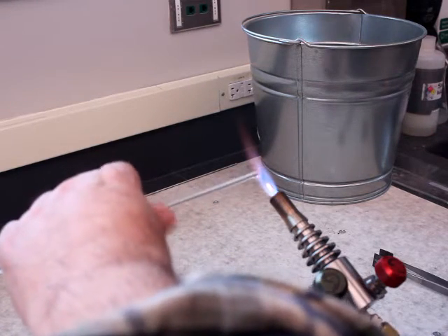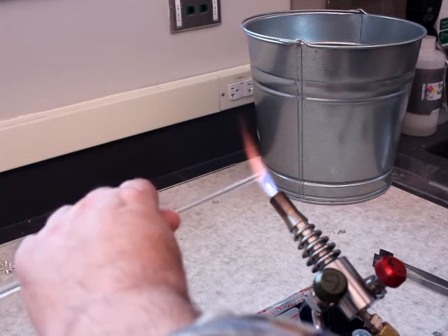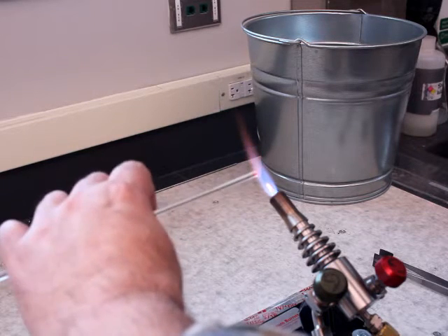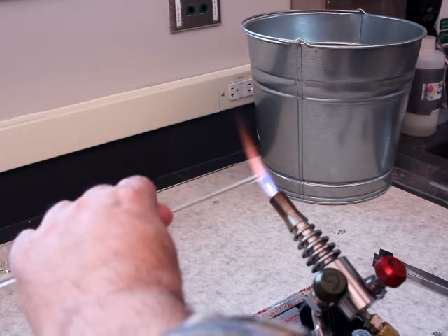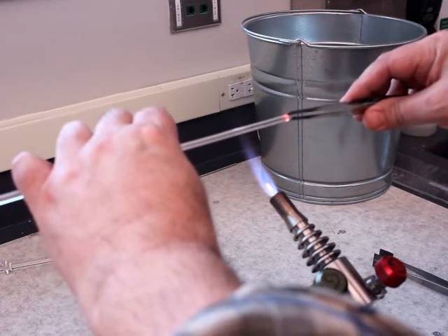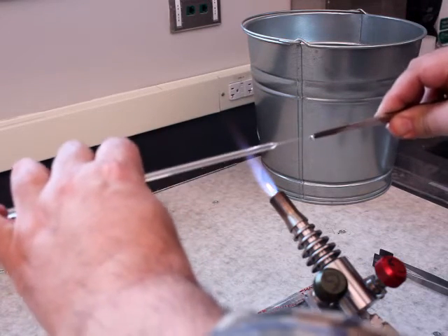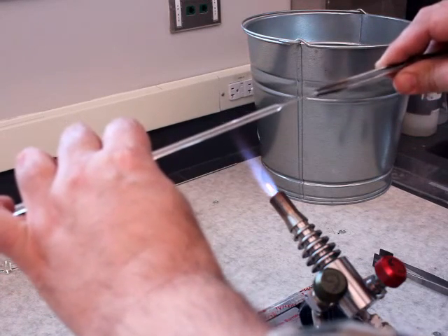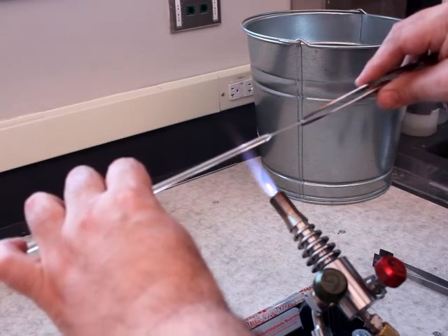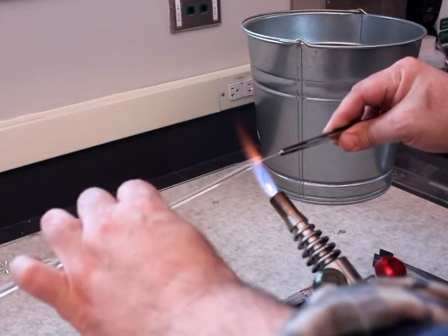However, it's always a good idea to remove the edge of the glass rod that was broken, to remove any defects. So I'm going to heat this back up and with my tweezers come in here, pinch it, and give it a little pull. You can see I've pulled a little glass blob here and I've got this glass filament. Now I come back in near the top of the flame if you want, just burn that off.